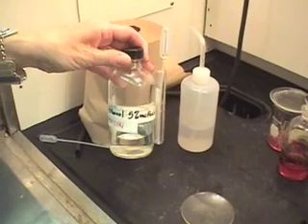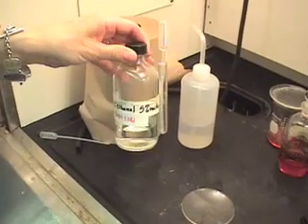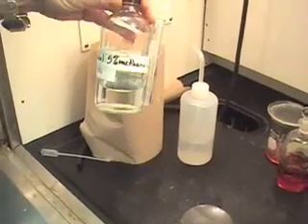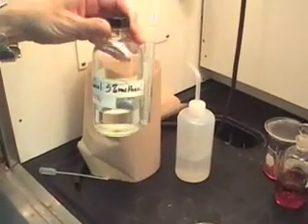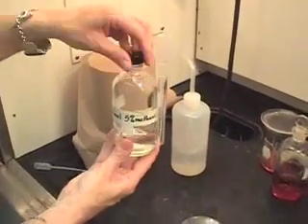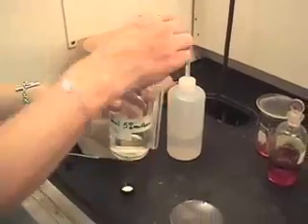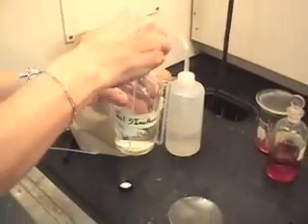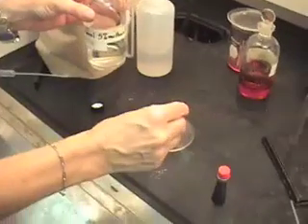How would I classify this stuff? The label says 95% ethanol and 5% methanol. Notice it's a clear colorless liquid, but there are two things in it, so it has to be a mixture. This is called a homogeneous mixture, and we tend to call homogeneous mixtures like this solutions.